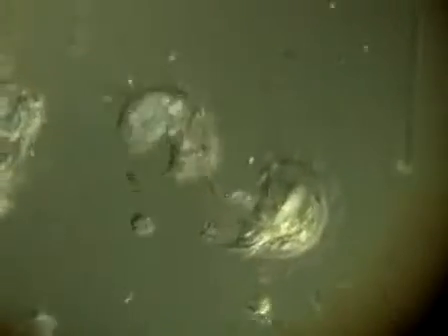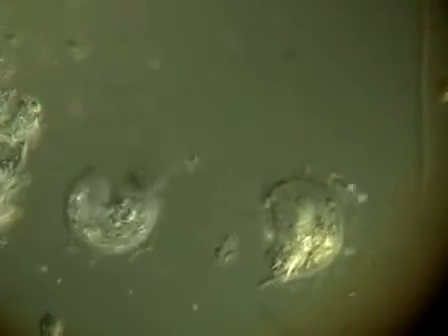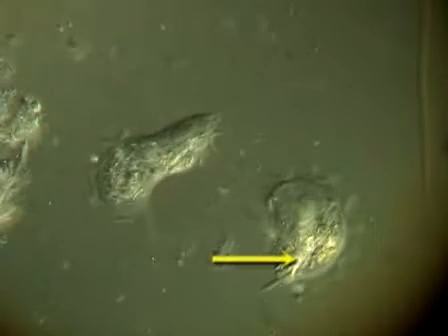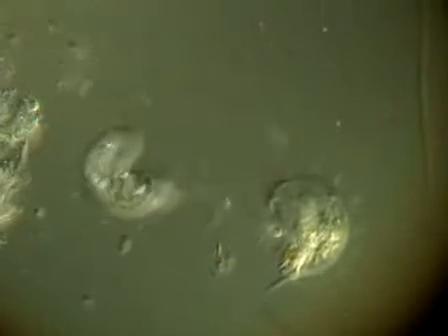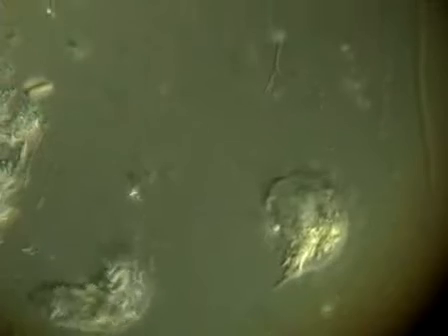Whereas under a different type of microscopy, the whole cell may appear gray on a light background or white on a black background. Here you'll start to see textures on the actual cell or within the actual cell itself. And for many of the protozoa that we have, the larger eukaryotes, that will allow you to see not only internal structures in the cell, but also perhaps particles of wood. And so here, right now, we're looking at two gut protozoa. These belong to the genus Trichomitopsis. These are cellulose degrading protozoa.